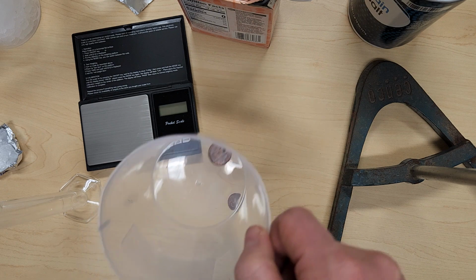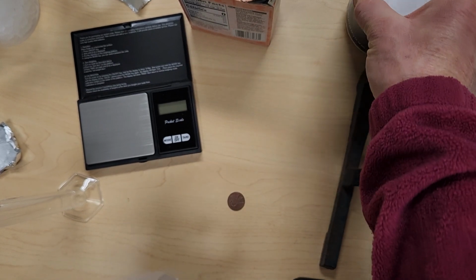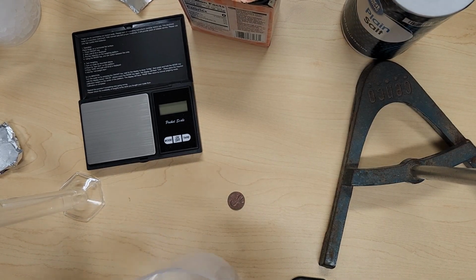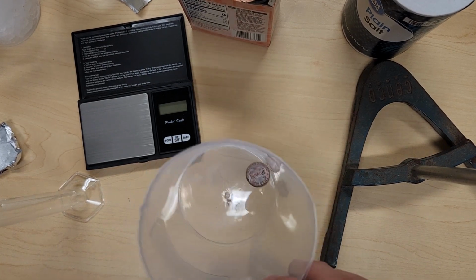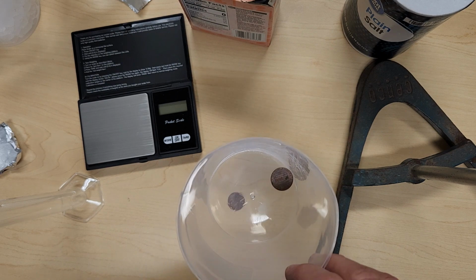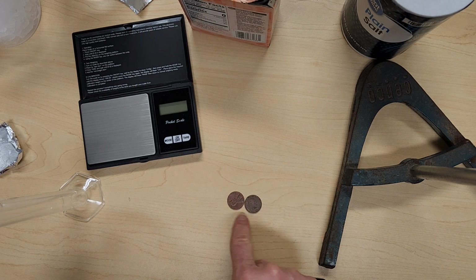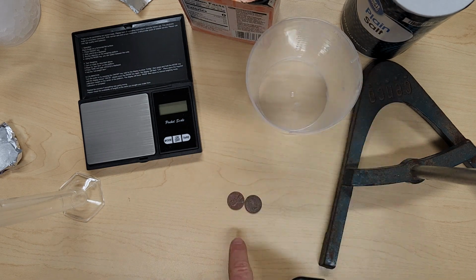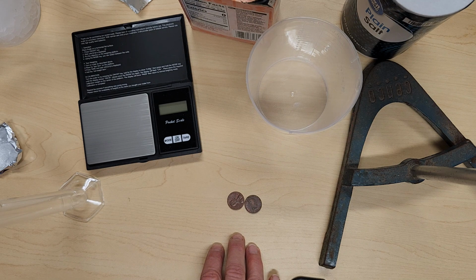Okay. Then we're going to try adding vinegar and also some salt, waiting 2 to 5 minutes. Okay, we're going to wait 2 to 5 minutes, remove the penny, rinse and dry it, see if anything has changed. So once we've added that vinegar and salt, did anything change from where we started at? How has that looked? So you can take a picture before, you can take a picture after, include your observations and explanation as to why you think either a physical or chemical change has occurred.